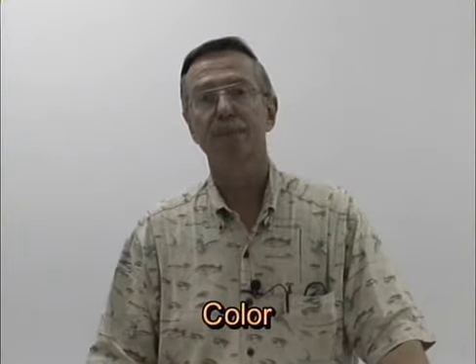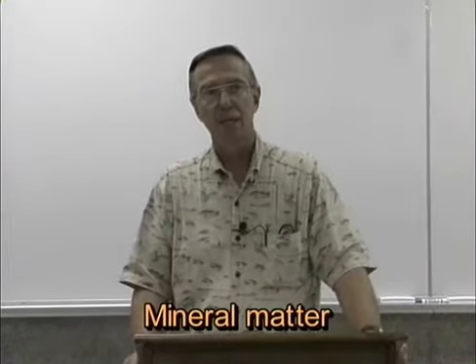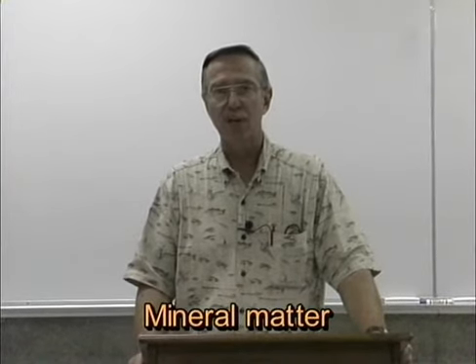Another procedure that we will do in the lab today is soil color. Now, the color of a soil is a reflection of several different substances which occur in soils. One of the major constituents of the soil is the mineral matter. Mineral matter in the soil will impart a certain color to that soil, primarily based upon the types of elements in those minerals and the degree of oxidation that they have undergone. This is particularly true of elements such as iron. Iron, as it oxidizes, will impart a more reddish, brownish color to the soil. That's an example of that.